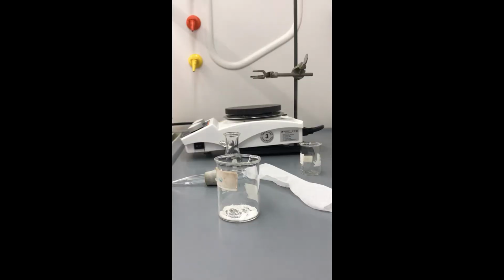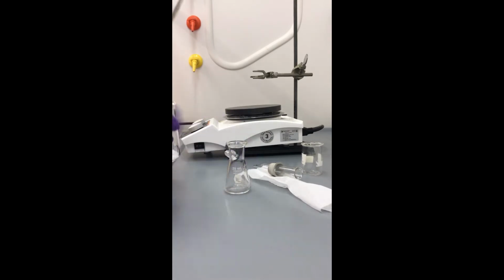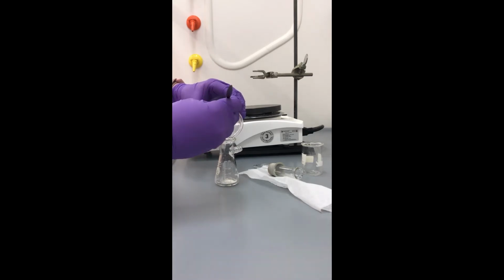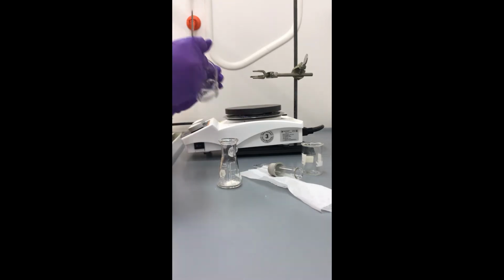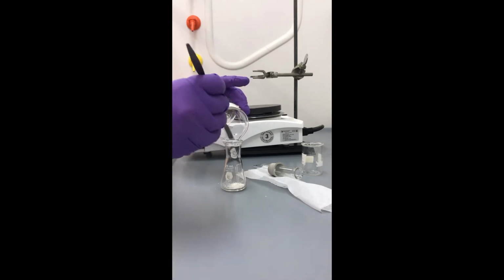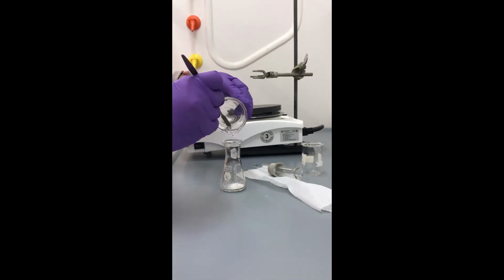To purify the crude naphthalene, we are going to perform a sublimation deposition. The hot plate was placed on the base of the ring stand, and a 3-fingered clamp has been clamped to the ring stand. Scrape as much of the crude naphthalene crystals as you can into the 25 milliliter Erlenmeyer filter flask. Unfortunately, you will not be able to get all of the crystals from the beaker into the filter flask.